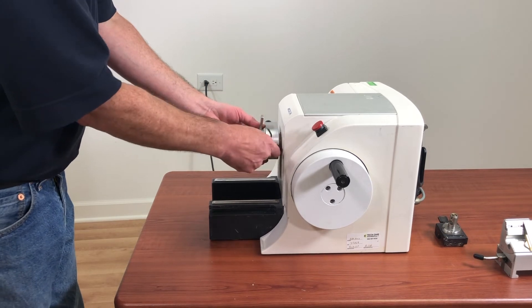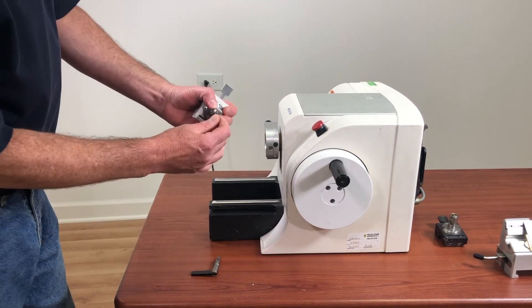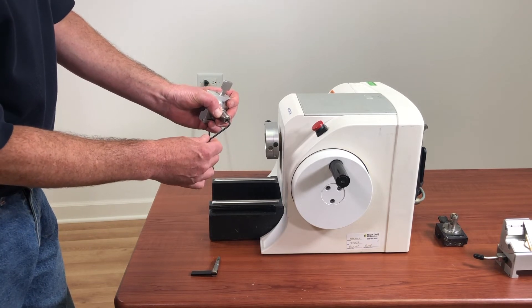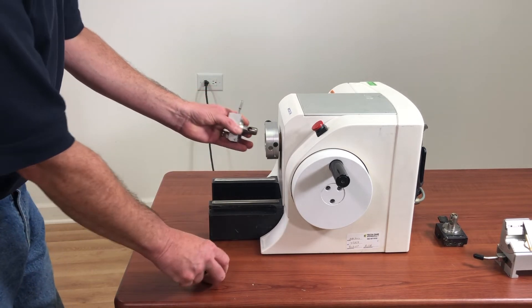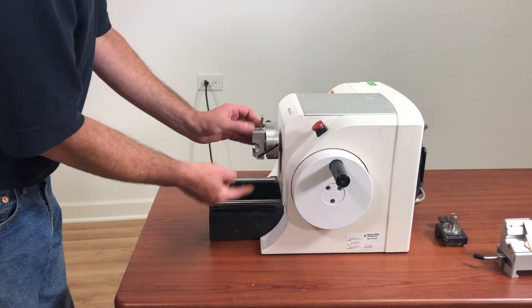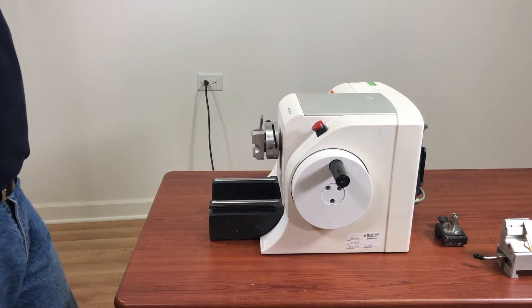So we'll take it out again and turn the screw just a little bit more — about a 16th of a turn. The very little bit is plenty. Reinstall it again, put that back in, and now it's good and tight.